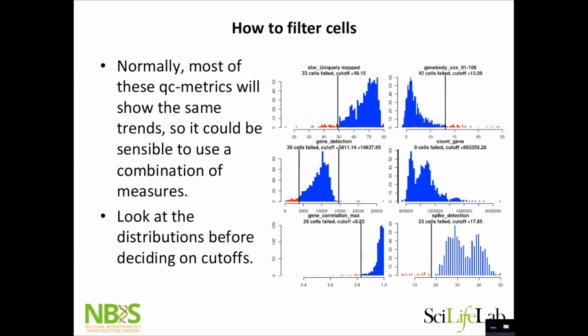So then how do you filter? I say look at the distributions. Look at how it looks for each sample you're doing, because then you get a feeling for what is out here, it's all crappy. But then you might have, for instance, red blood cells that are really tiny with low amounts of RNA that are out here. And then it's up to you if you want to keep the red blood cells or not, depending on what your question is. Here is how many reads we have at the 3' end, where it's extremely high for some cells, then I would take them out. Gene detection here, I would say these are clearly doublets here and failed libraries. So I always look at the distributions and try to make some reasonable cutoffs for each sample.